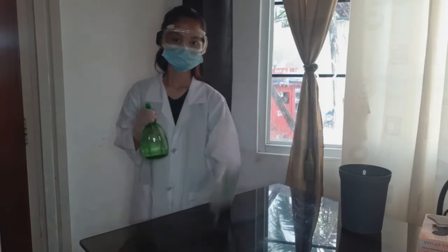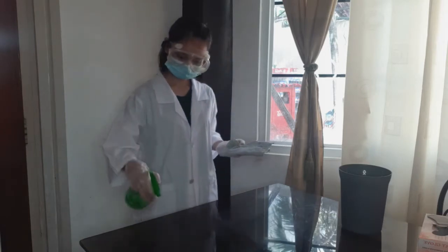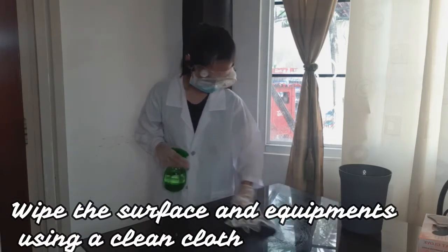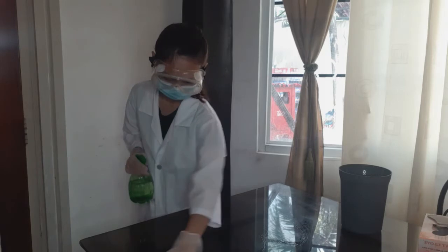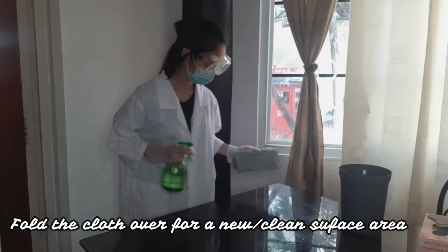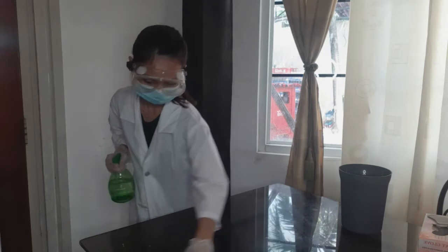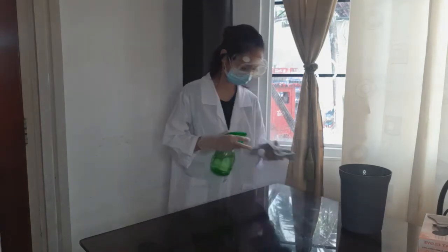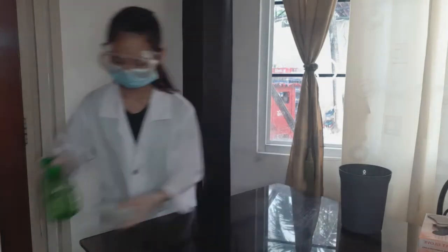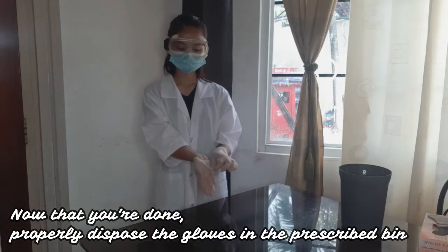Grab your spray bottle and your clean cloth and spray the surface of your working area. Wipe the surface and equipments using a clean cloth. Fold the cloth over for a new or clean surface area. Now that you're done, properly dispose the gloves in the prescribed bin.